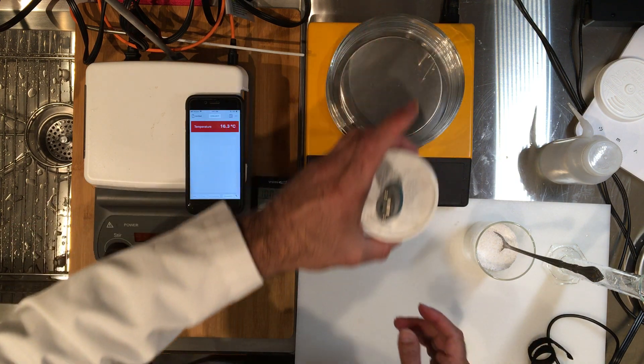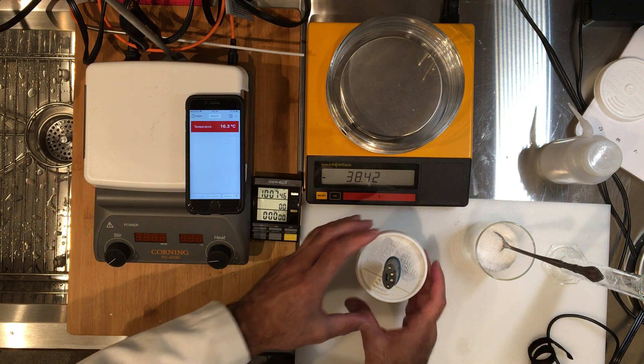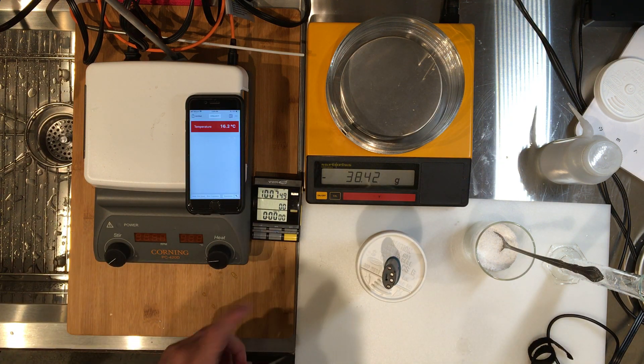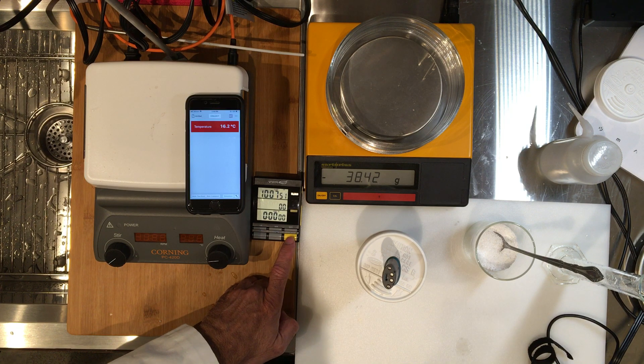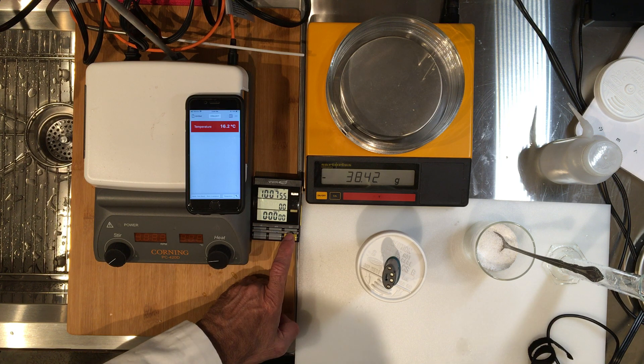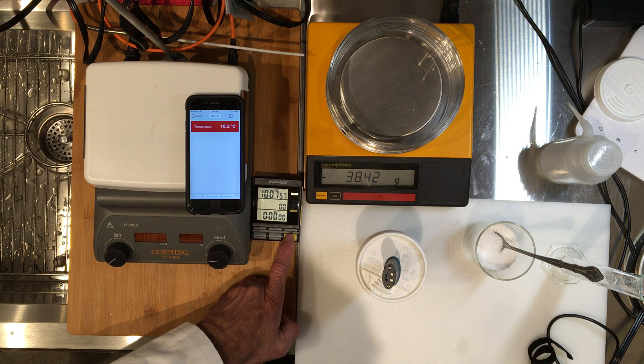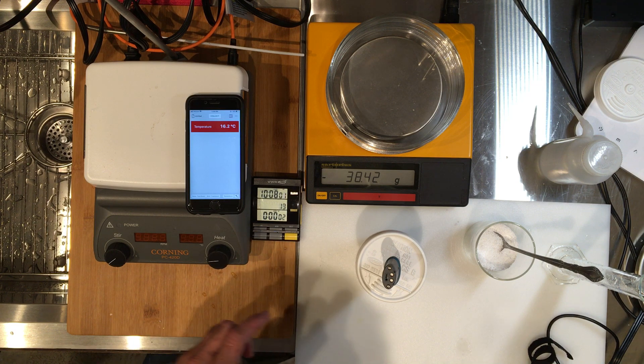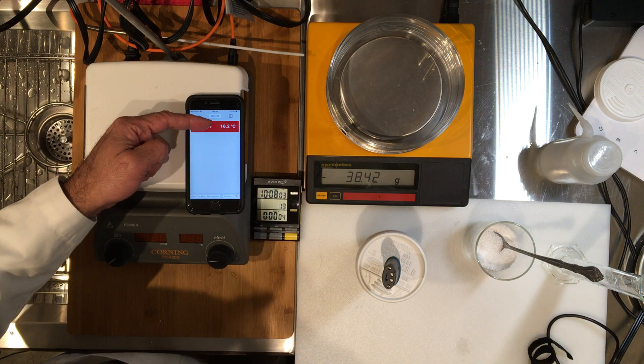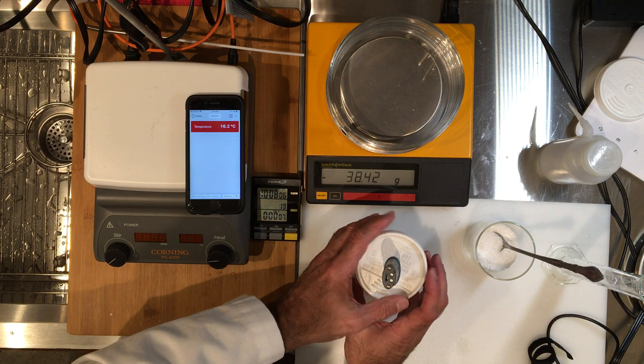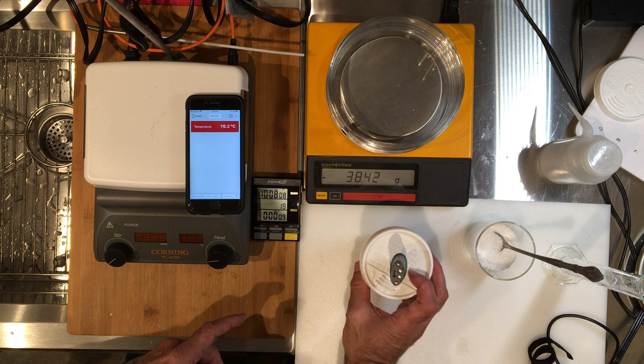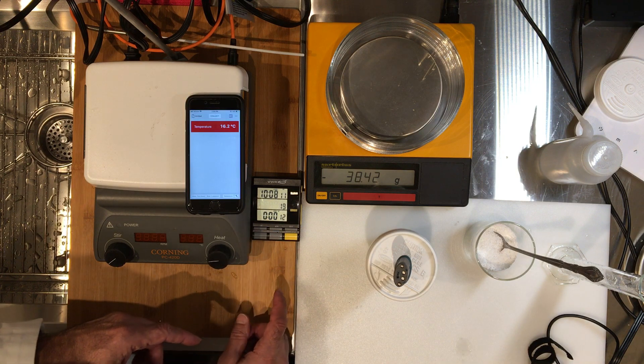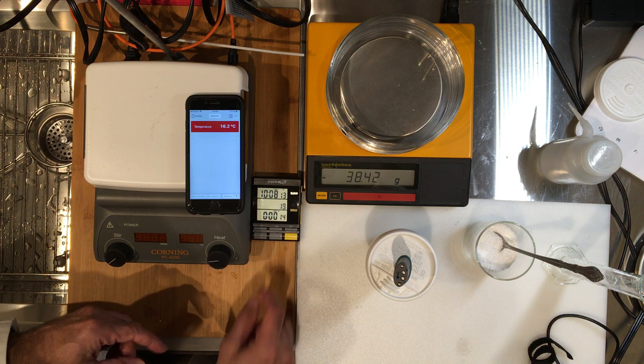So we're going to now take this out and get ready. Let's establish a baseline first. I'm going to start my timer, so at this point start recording every 15 seconds. I haven't added the chemicals yet, but this temperature will stay pretty constant. You are really measuring the temperature of water right now, which is 16.2 degrees Celsius. So record it every 15 seconds. The first one is coming up, so keep your eyes on the timer.